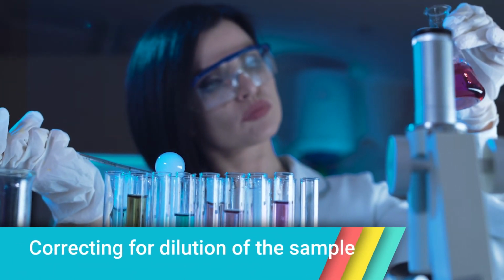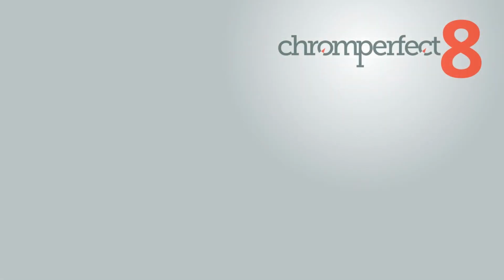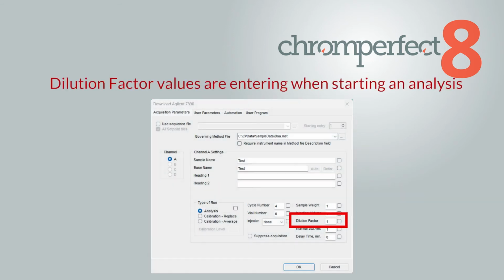Correcting for dilution of the sample. Sometimes a sample contains more than the usual amount of analyte, enough to overload the column or detector. Such samples must be diluted until they produce peaks of reasonable size. The raw amounts are correspondingly reduced, but multiplication by the dilution factor generates the correct values for the final amount.